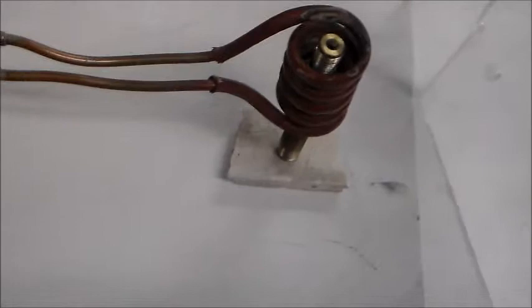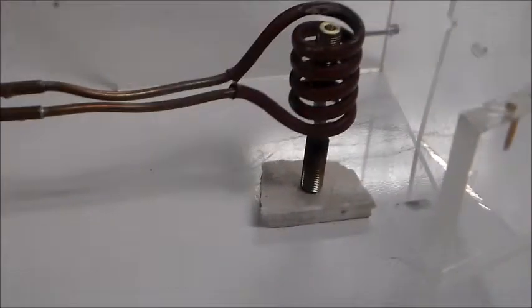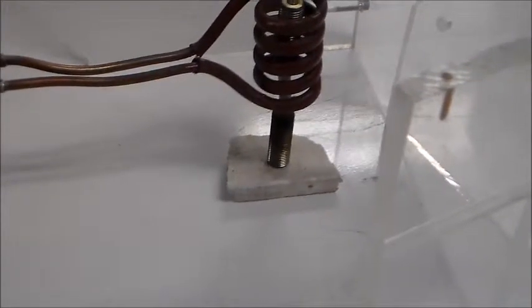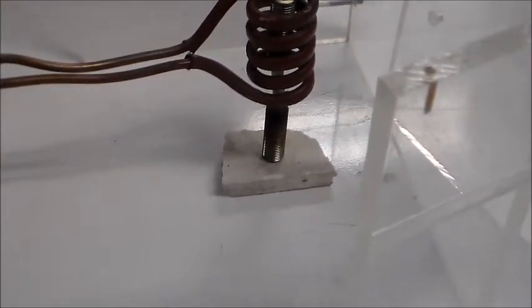Also, please be aware that you need to use a non-conductive material at the bottom of the sample unit that is going to be heated. In this case, I'm using a piece of ceramic material which is a non-conductive material.